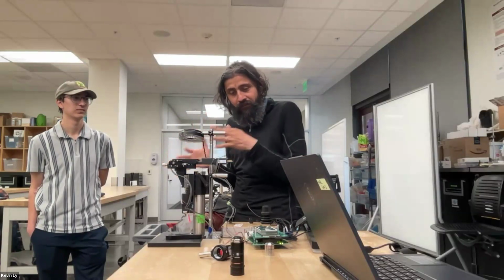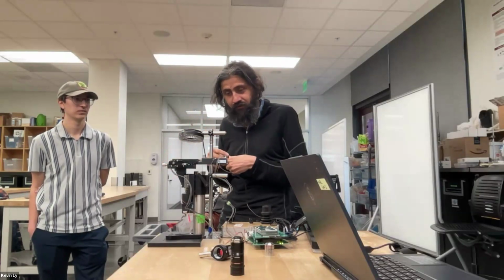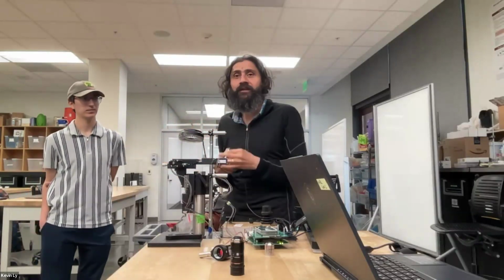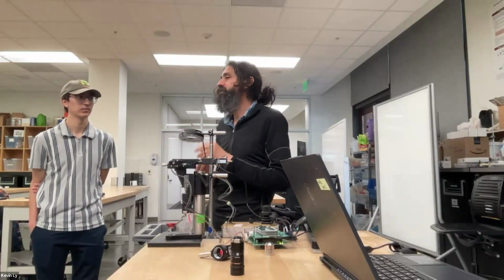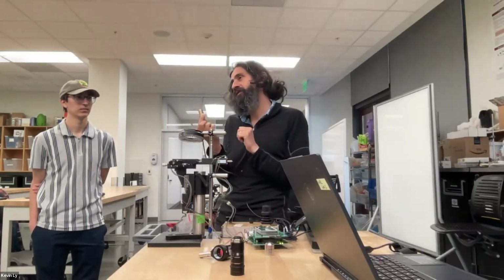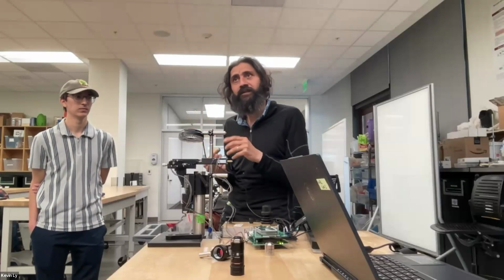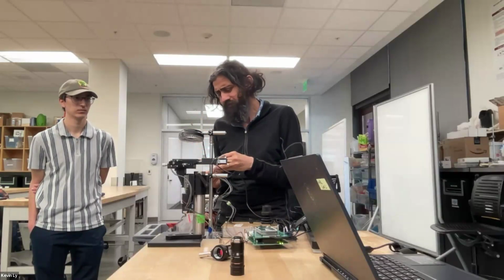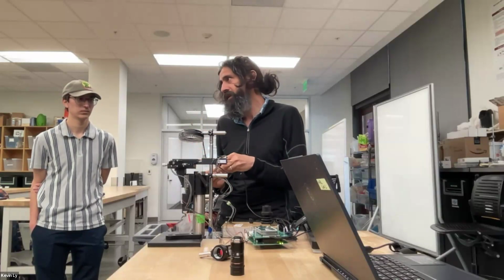But I can tell you, as a pipeline, the factory that was just making lots and lots of objectives is kind of like a Ford factory. You assemble this part, then it assembles that part. In one objective, I would say it would probably take a day or two if there was just one person given all the optics to assemble it and correct for it and test it and mount it. But this is important, and there is an industry out there for that, and there is a very large number of types of lenses. So this is another key component.